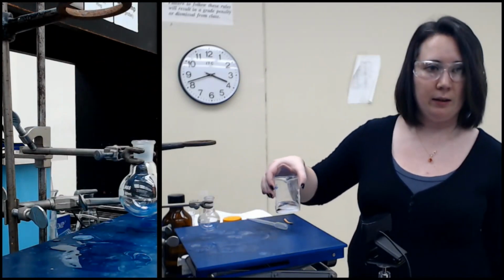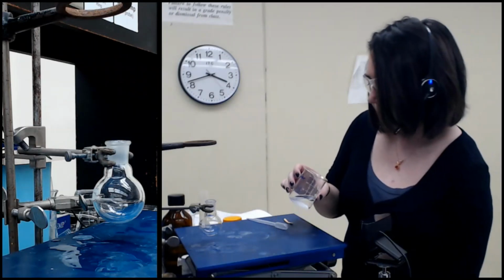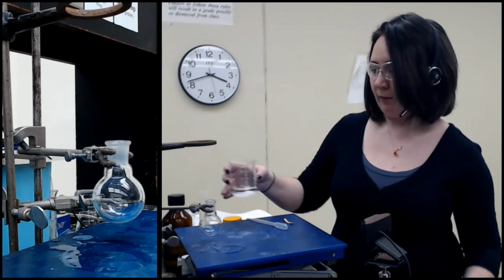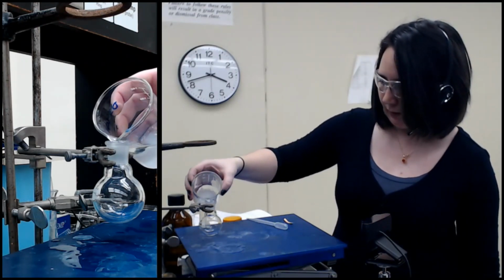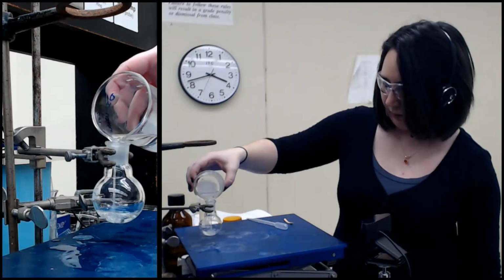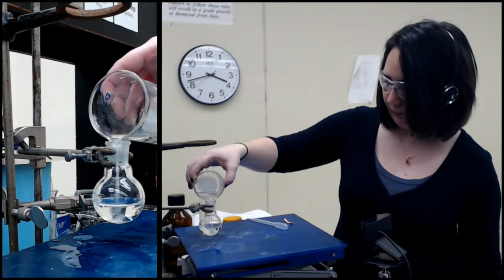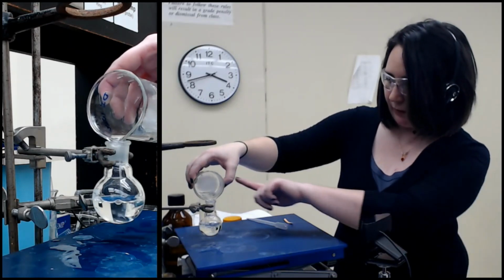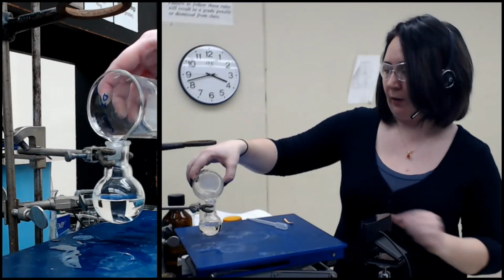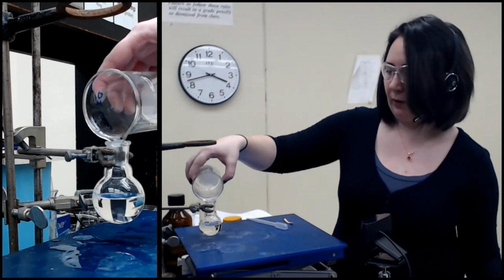So it's been sitting over here. It looks nice and clear. Decanting is simply pouring, leaving a solid behind. So I'm just going to carefully pour, and I'm going to make sure that the solid stays left behind, because I don't want that messing up my mass or my melting point later on. If you were uncertain about this, if you thought there was a bunch that would come out with it, for instance, magnesium sulfate or a very fine powder, I would probably not decant. I would probably do a full gravity filtration.